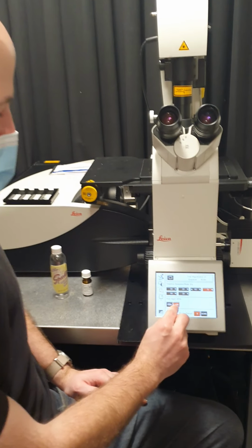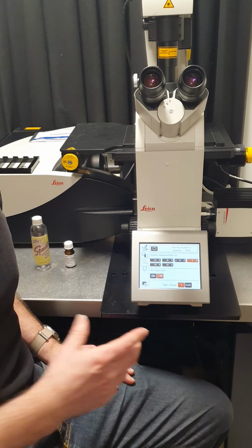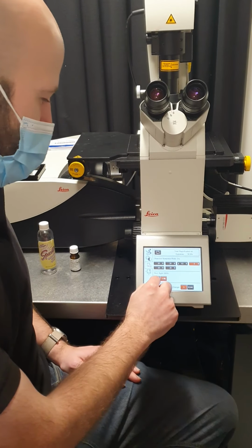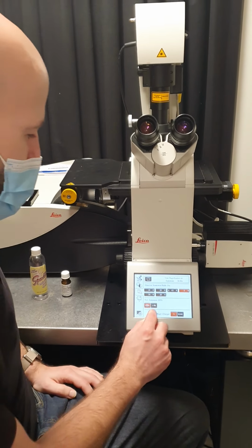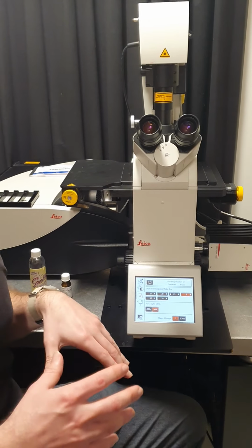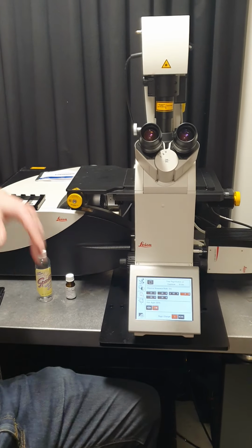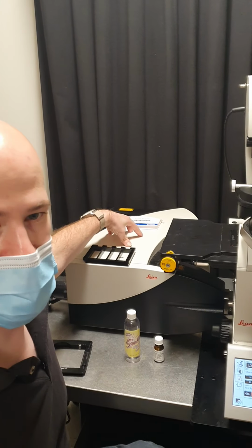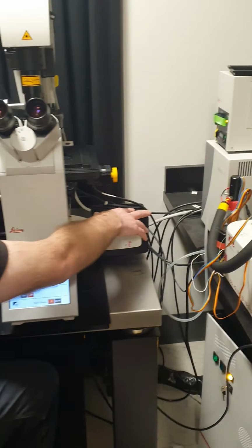And then this little pair of icons with the eyeball and the camera, that's telling the microscope where to send the light coming from the sample. So if it's on the eyeball, it'll send it up here to the eyepieces. If it's on the camera, it'll be sending it to whatever detector you're using. So if you're in confocal mode, the light will come over here to the confocal detectors. And if you're in bright field or wide field fluorescence, the light will come over here to the camera.